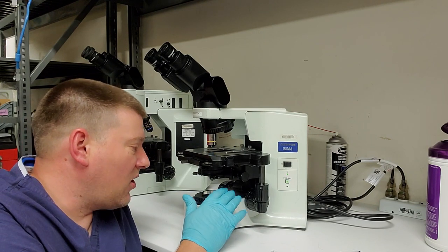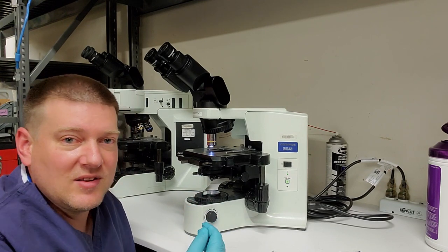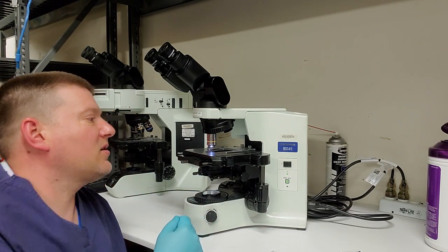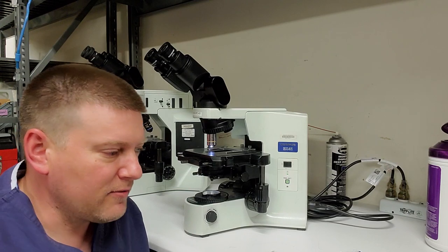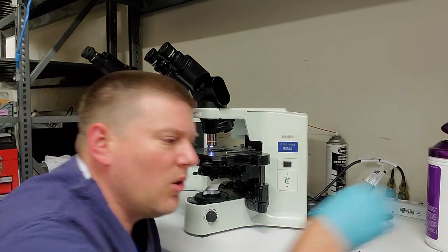So if your iris is all the way closed, and the doctor never adjusts it, he wouldn't think about that. He's going to put in a work order for a broken microscope. So, just a word of caution. It's happened to many of us. Open all the irises all the way up.